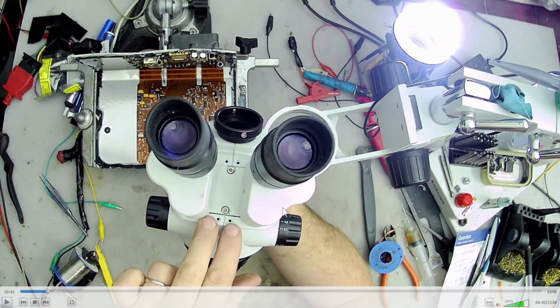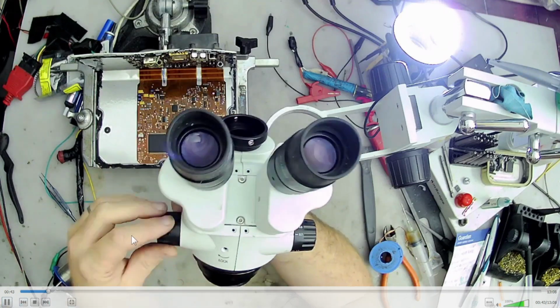Here, I had already removed these, and it was a mistake to do so. What these are is they're four screws here, but for each two, there's a bar connecting them, and that's used to hold the case together. But what you should do is only take out one here and one here, so the bar doesn't fall, and it's easier to put back together.